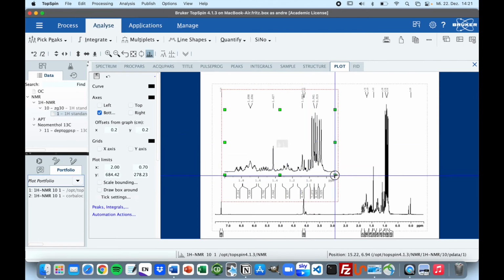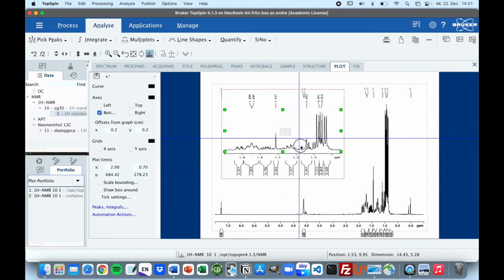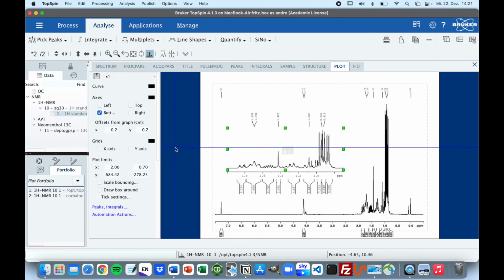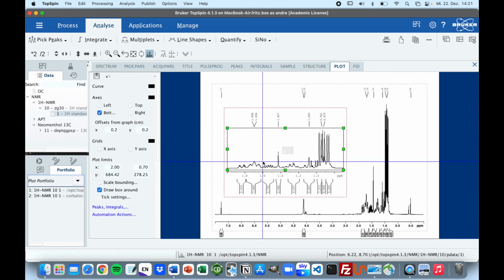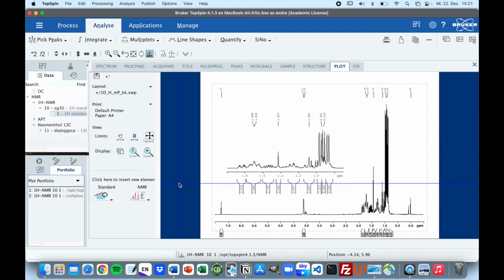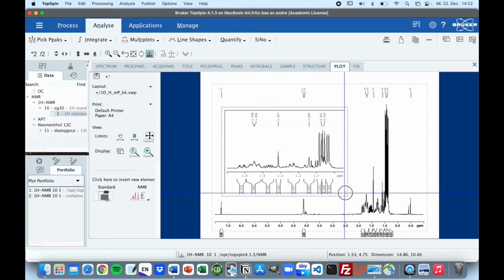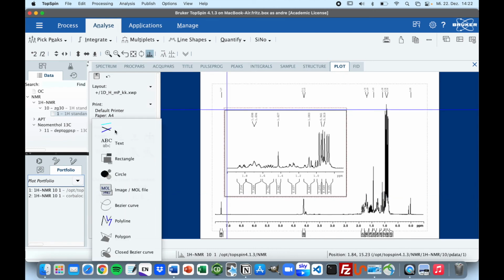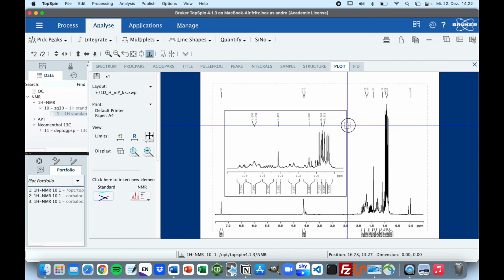And we'll just make it a bit smaller so it won't overlap with any of the other signals we have here. And now it's just kind of your personal preference if you want to draw a box around this way, so you can really see that it is an inlet, or you can leave it like this. You will click on this blue area and you can draw a box around it manually, so you can really have everything you want in this right here. And you can even select a line and drag it into this area you zoomed in.